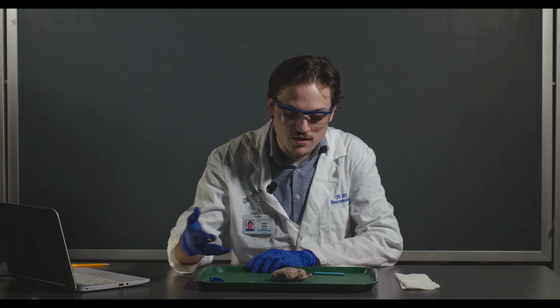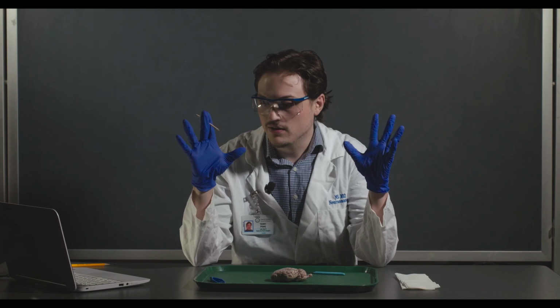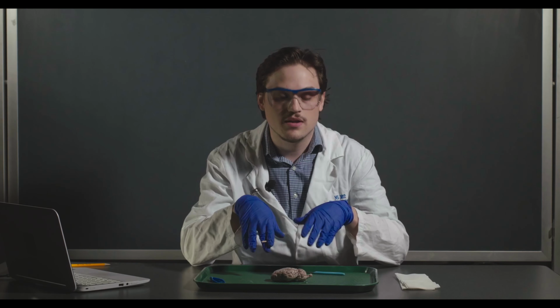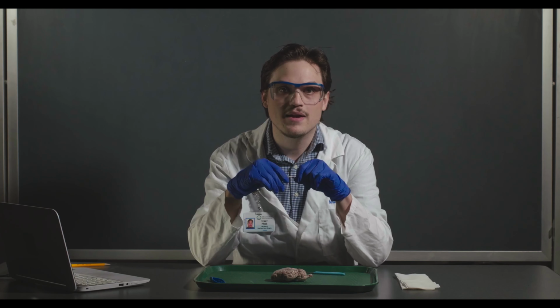Okay, so now we have our sheep brain, and we're going to go ahead and start doing the thalamus and basal ganglia dissection. If you're following along at home and you have your own sheep brain, you're essentially going to want to wear proper PPE. So notice that I've got gloves. I cleared the table of any models that I do not want anywhere near something like a specimen. I got goggles, my lab coat, and closed-toed shoes, long pants, that sort of thing.